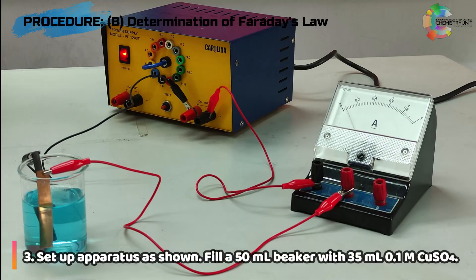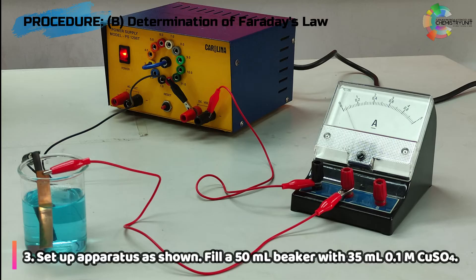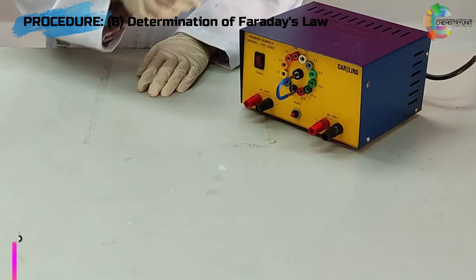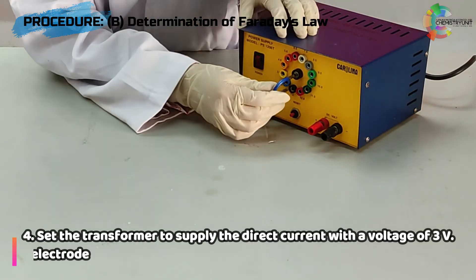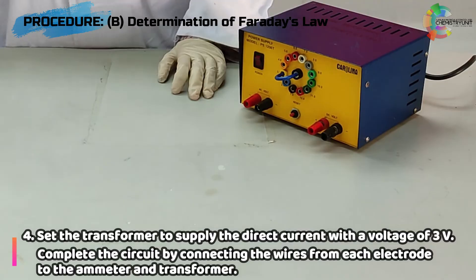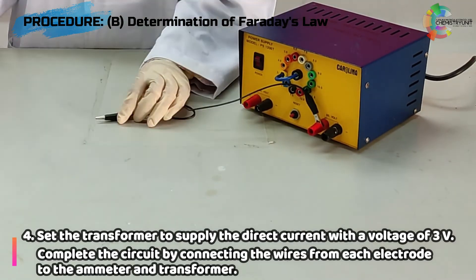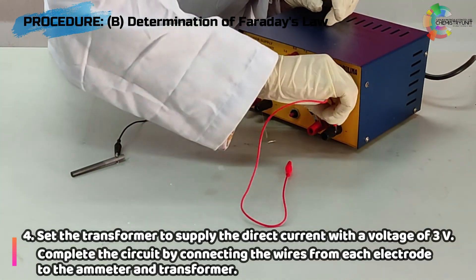In step 3, set up the apparatus as shown in the video. Fill a 50 ml beaker with 35 ml of 0.1 molar copper sulfate solution. After that, set the transformer to supply direct current with a voltage of 3 volts. Complete the circuit by connecting the wires from each electrode to the ammeter and transformer.